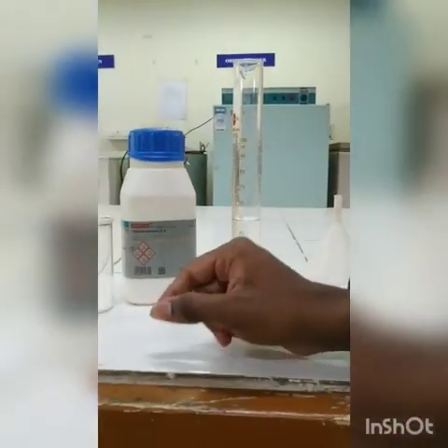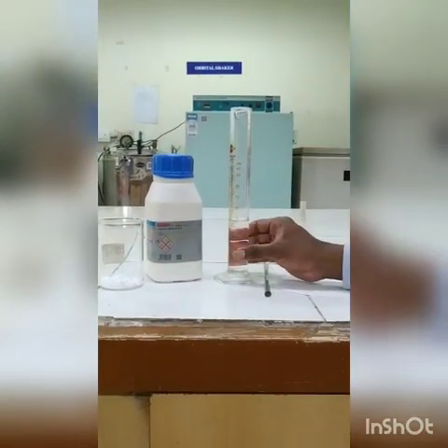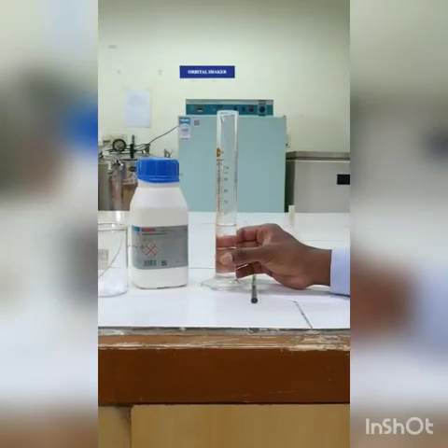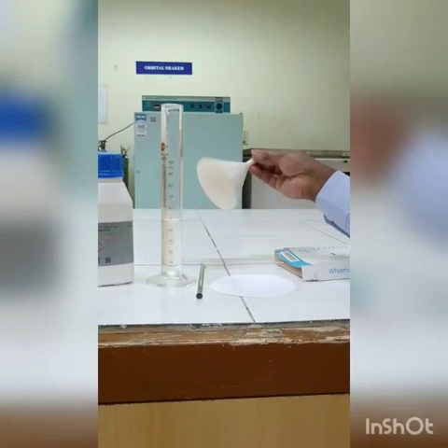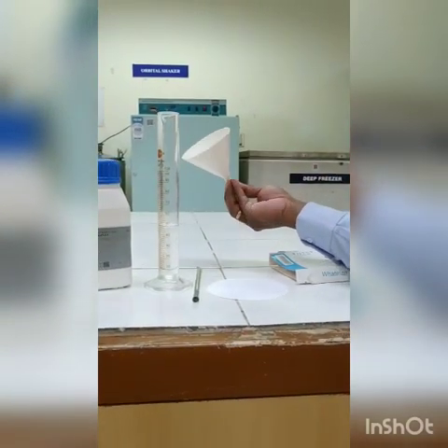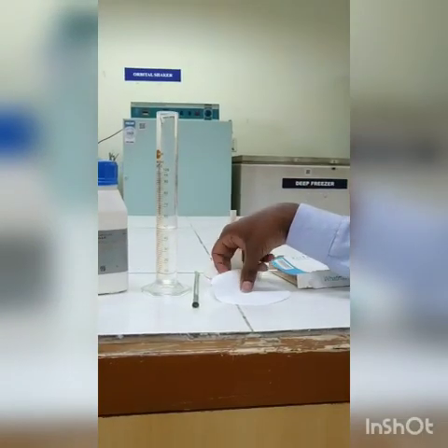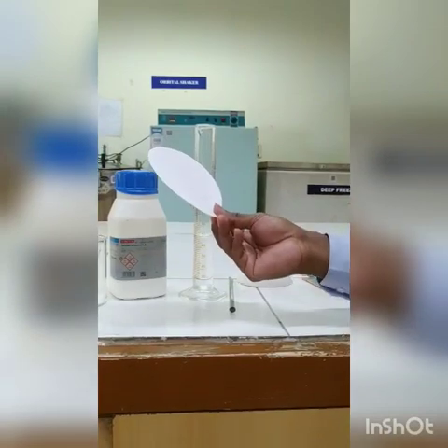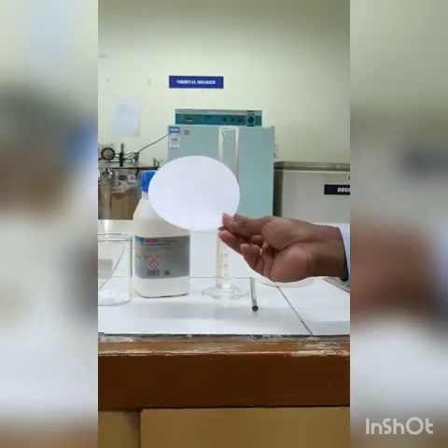So 10% calcium carbonate, 5 gram is taken, and we are going to mix it in 50 ml of water to create a mixture which has to be filtered through this filter medium that has been encircled inside this funnel. Okay. So these are the requirements. This filter medium has to be folded in such a way that it has to be fixed inside the funnel. Let us see how it is being folded.